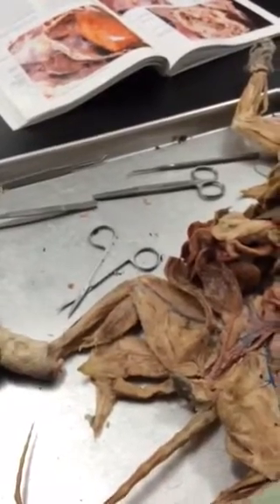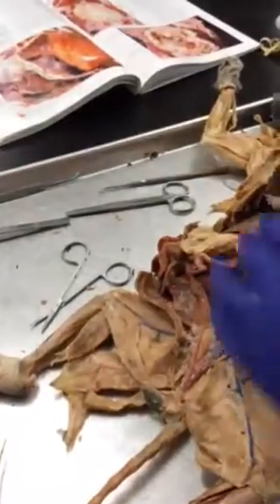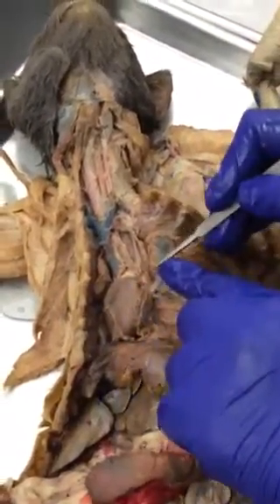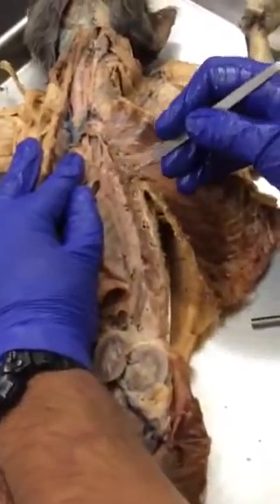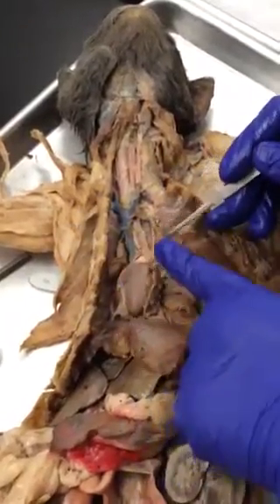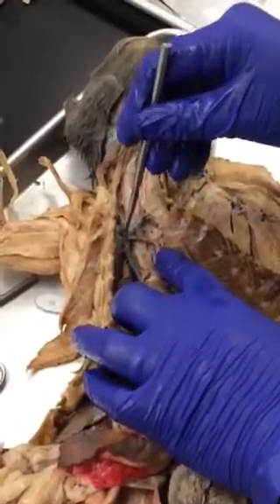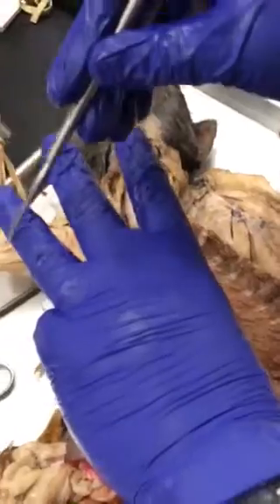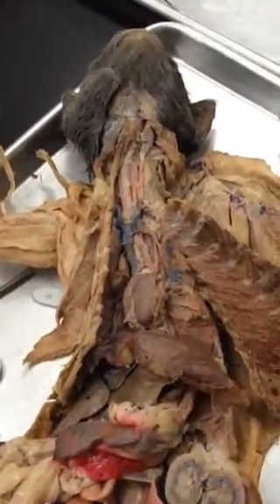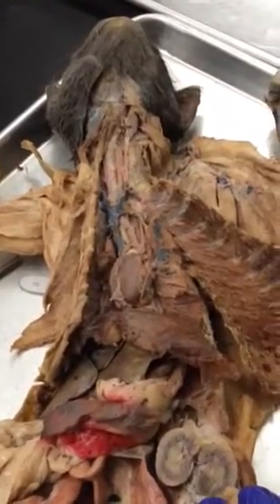Now for blood vessels: the aorta makes an arch — this entire part is the aortic arch. Following it down, it continues as the dorsal aorta. Before forming the dorsal aorta it makes two branches: the first is the brachiocephalic artery, the second is the left subclavian artery. Following the brachiocephalic artery up, it forms three branches — the most lateral right one is the right subclavian artery. So the left subclavian arises from the aorta and the right subclavian arises from the brachiocephalic artery.